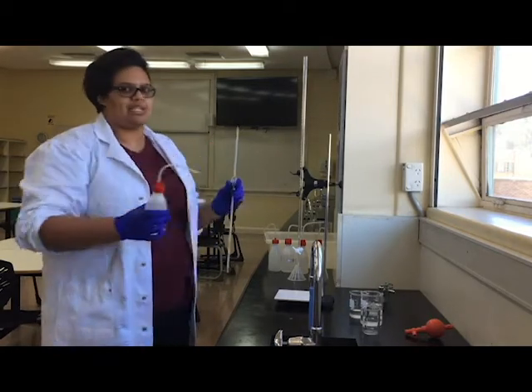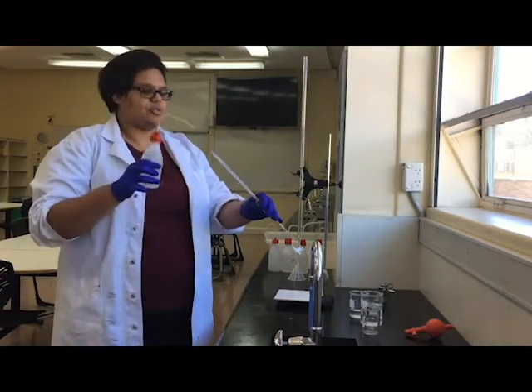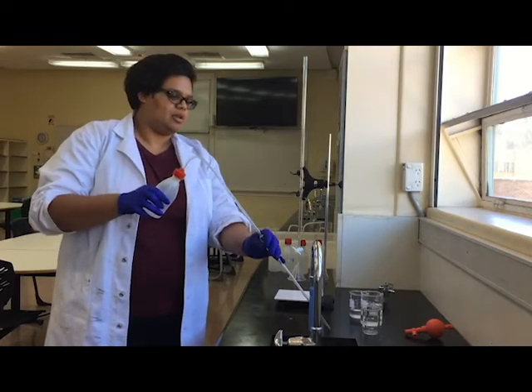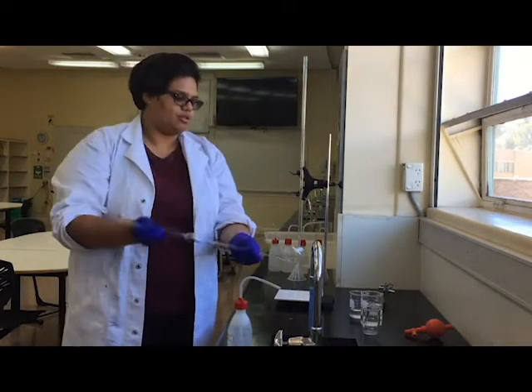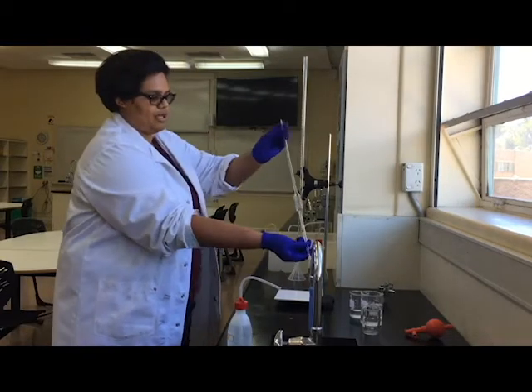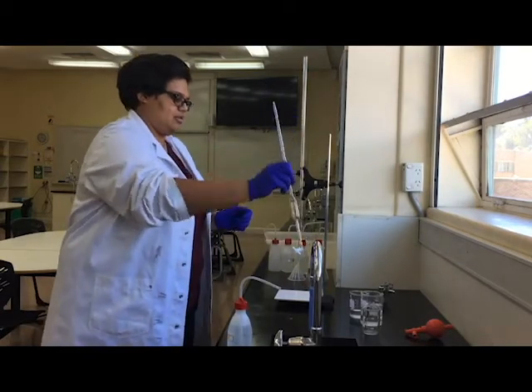Usually what we do is clean everything with distilled water at least twice. I'm going to do it once for this video. I'm just going to put some distilled water through the pipette, make sure it's gone all the way down, and put it through the other end as well.